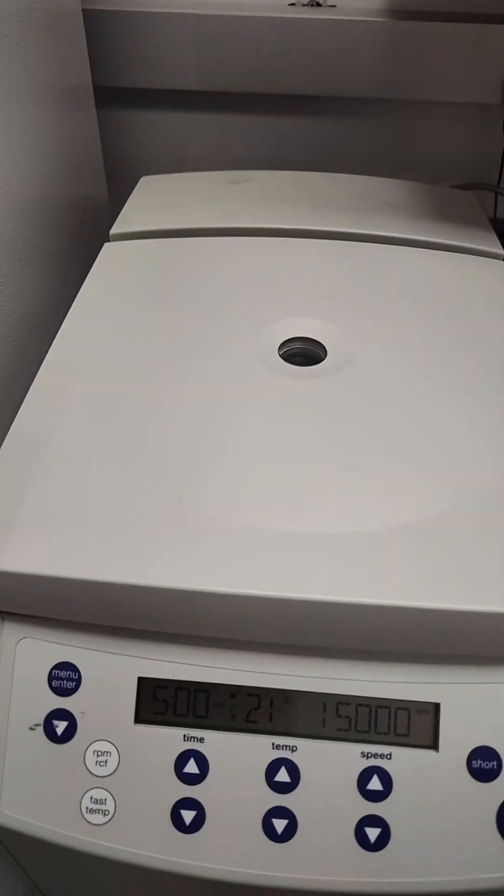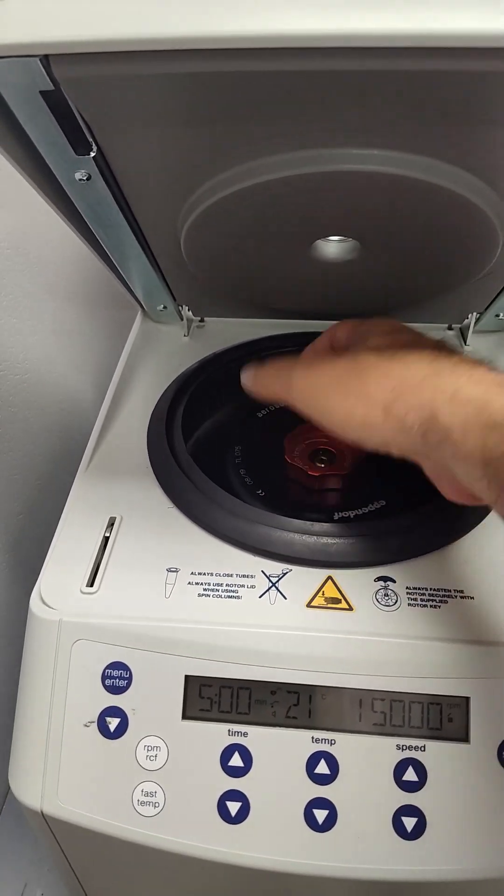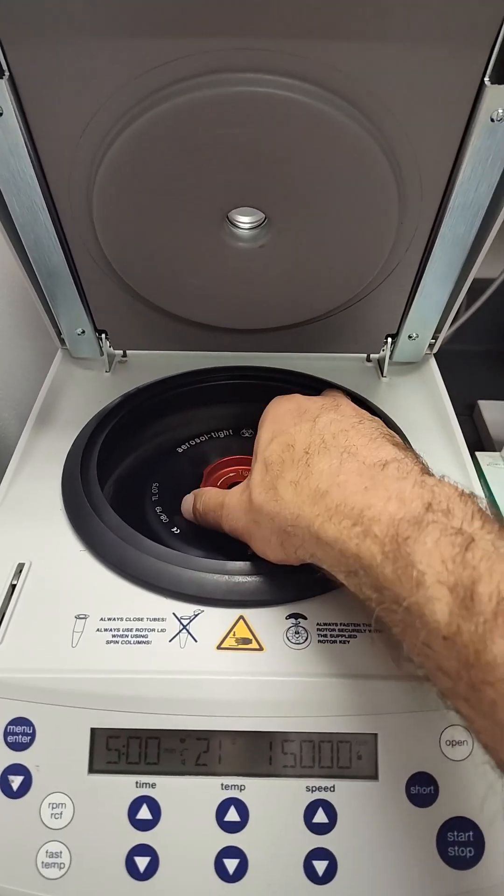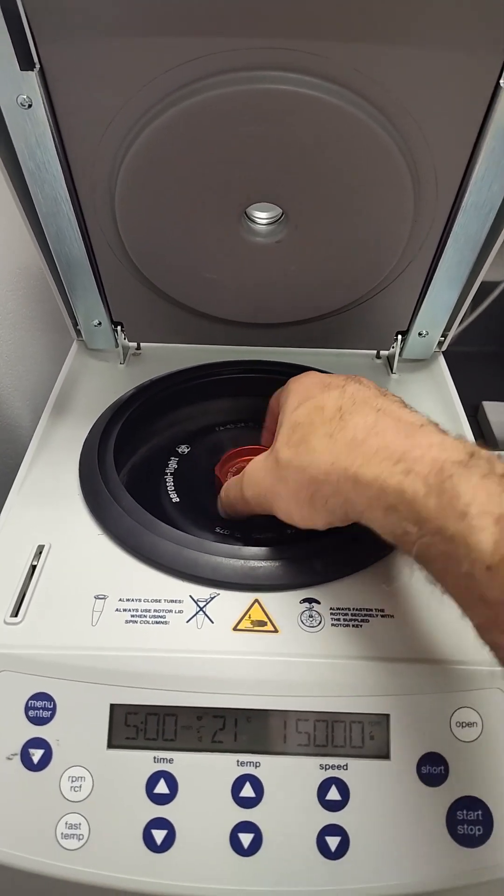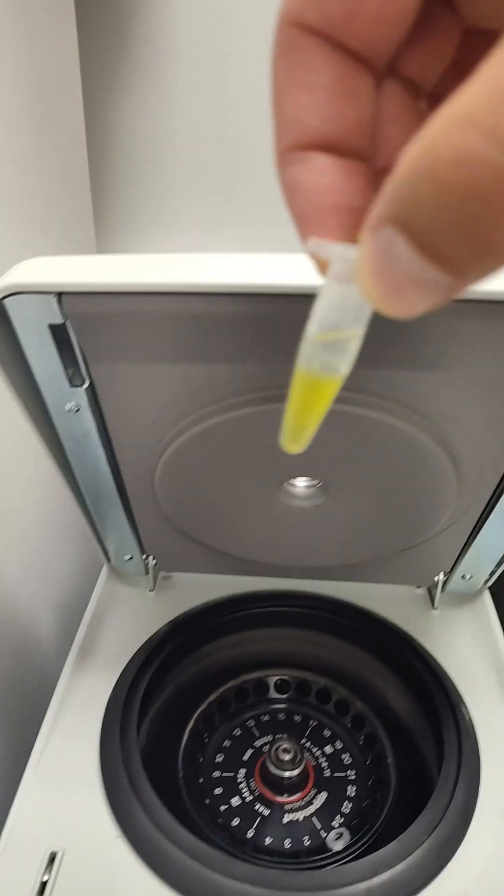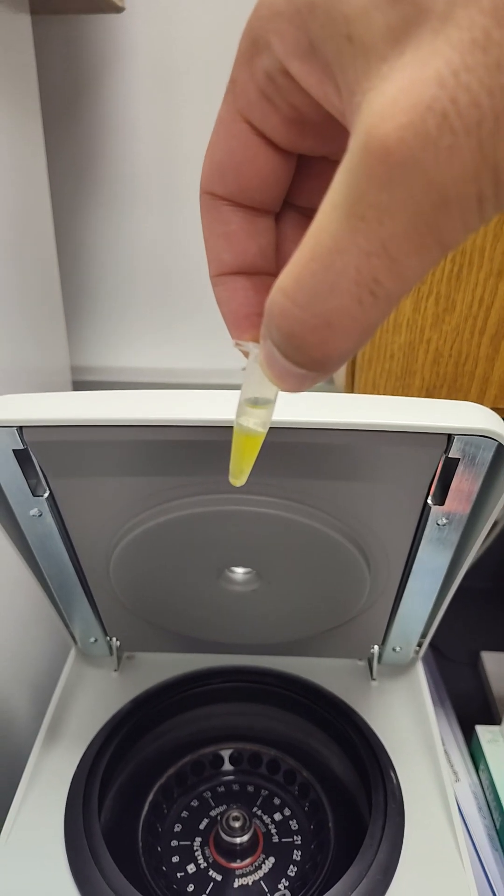Beeping means it's done. Open it up. So here's a skilled move, guys. You've got to hold the rotor with your pinky finger so you can unscrew it with one hand while you're holding this down. Hopefully we've got a nice clear-ish top layer. We do. And that's why they said it only takes 300 microliters. All the oil is on the bottom.